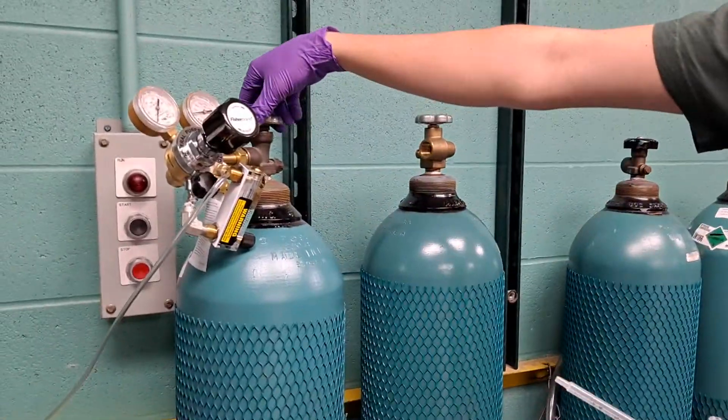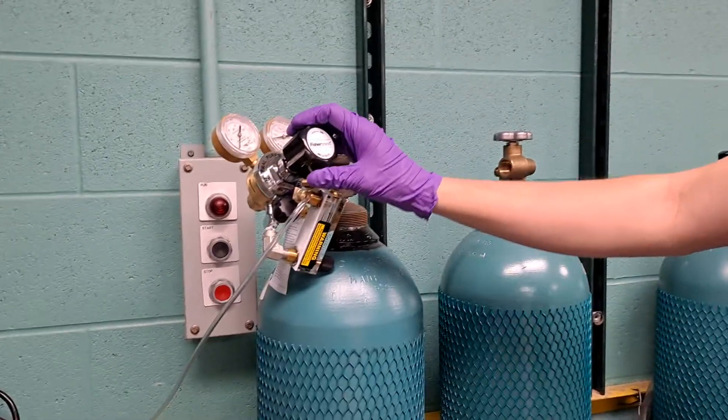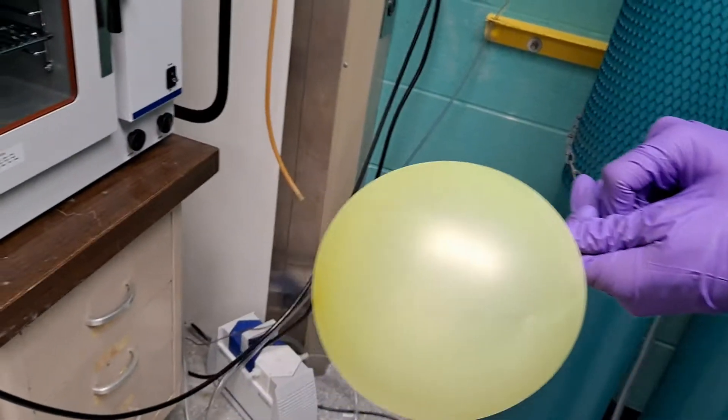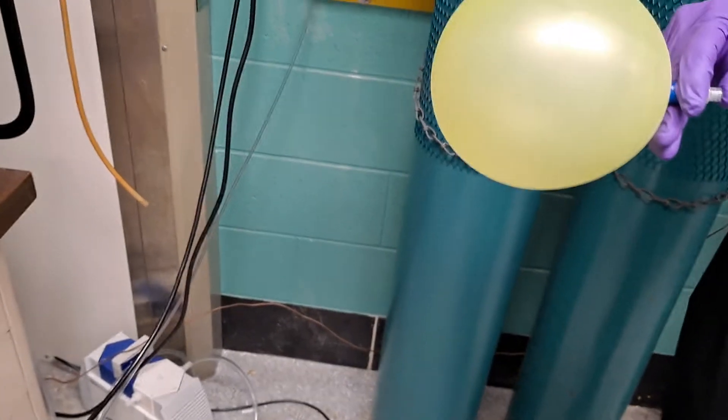So this is a nitrogen tank. First you make sure that this nozzle is on, and then make sure that the regulator is open.